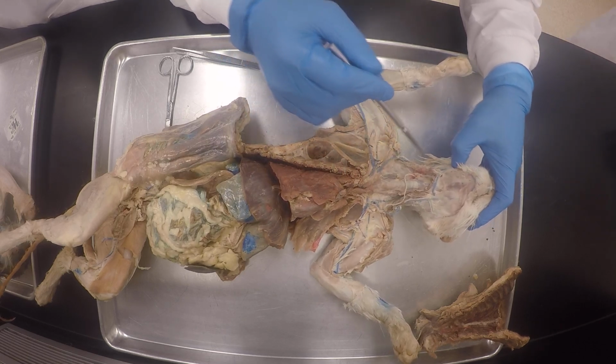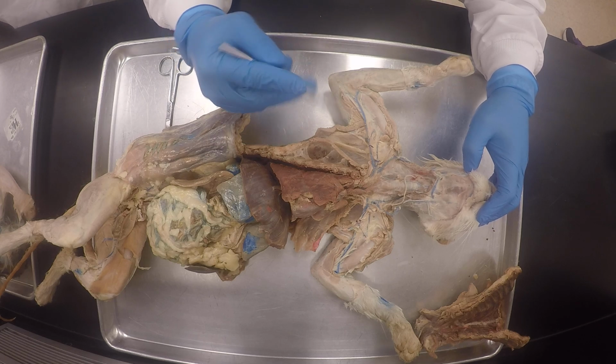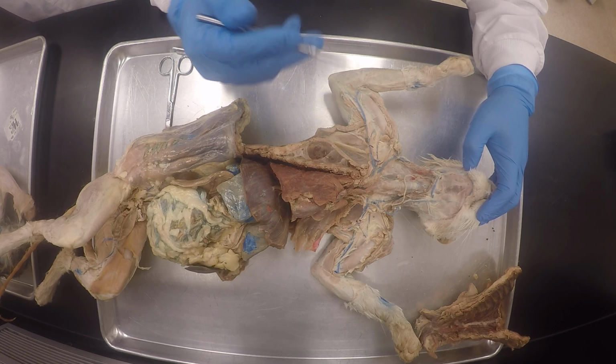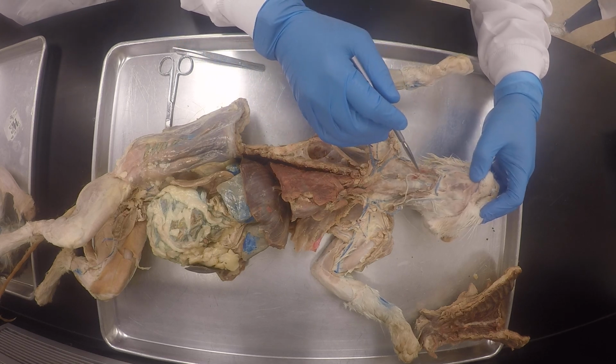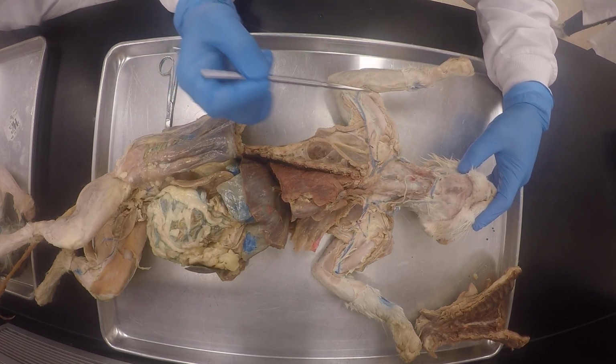My good friends, we have started here because now we're going to the circulatory system. I just wanted you to get a bit of experience making those incisions, but now let's focus on the circulatory system because this is what's going to matter for you guys. Okay?